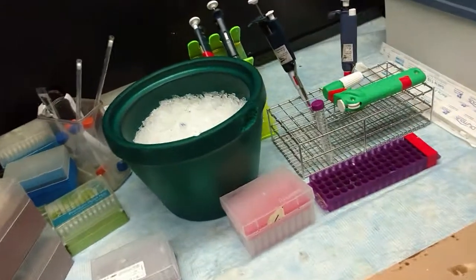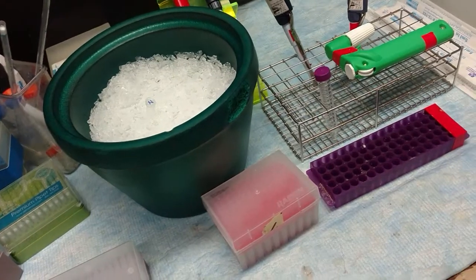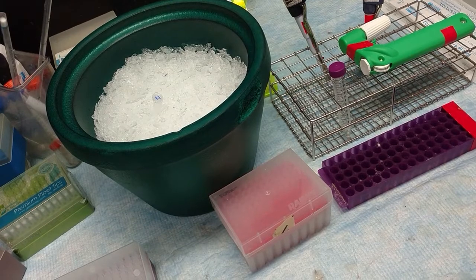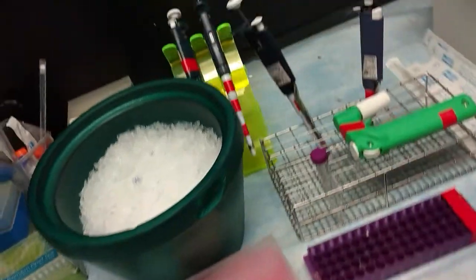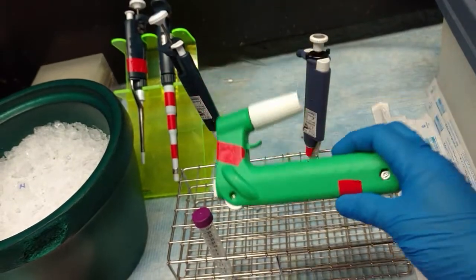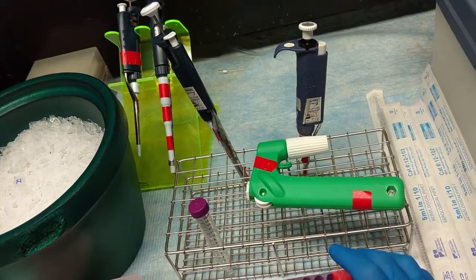We're going to start this in the hood. This is where you do DNA extraction, you use RNases and DNases. You're only going to do the very first part in the hood, after that you're going to move out. Notice the items that we use in the hood have red tape on them to show that they are for use in the hood.